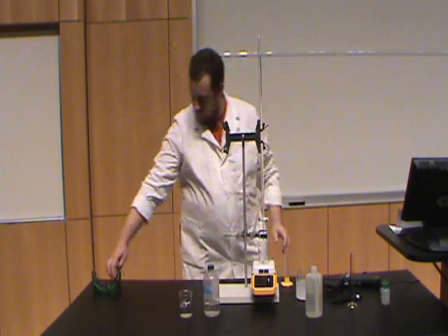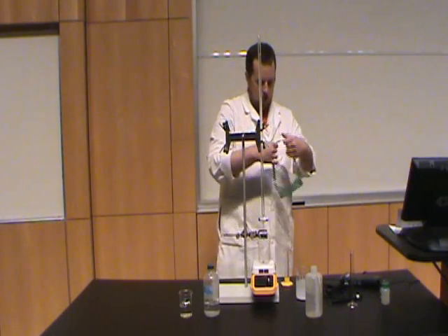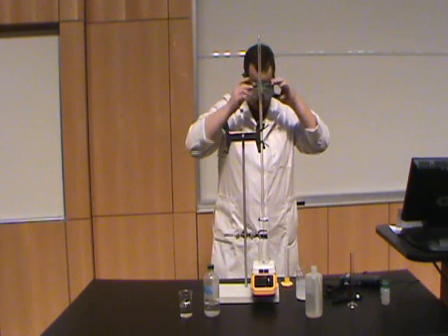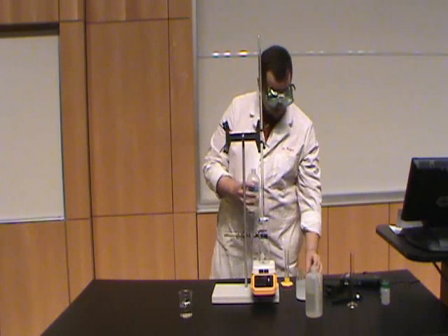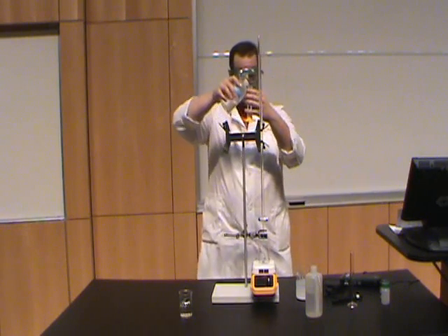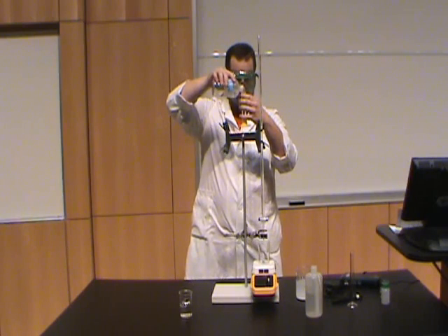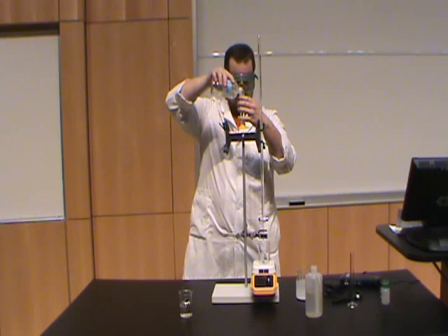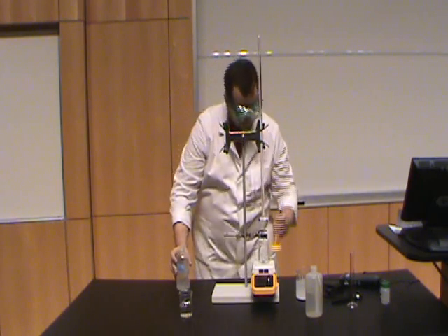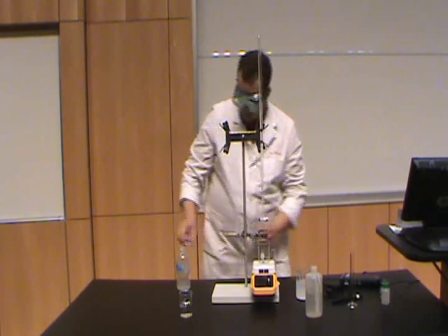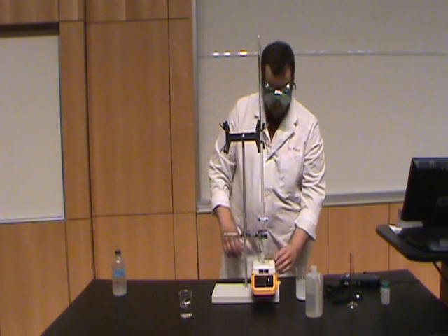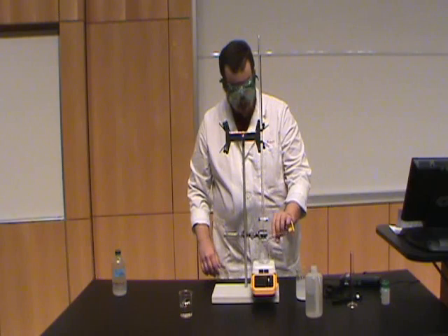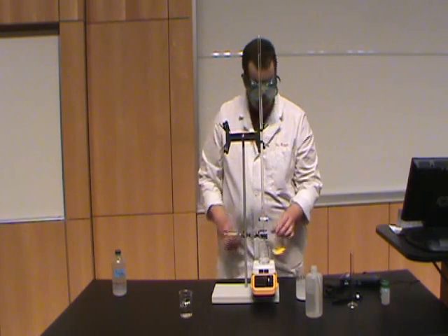Well, we need, according to the manual, 25 milliliters of barium hydroxide solution. Let's put that in the beaker for our experiment.